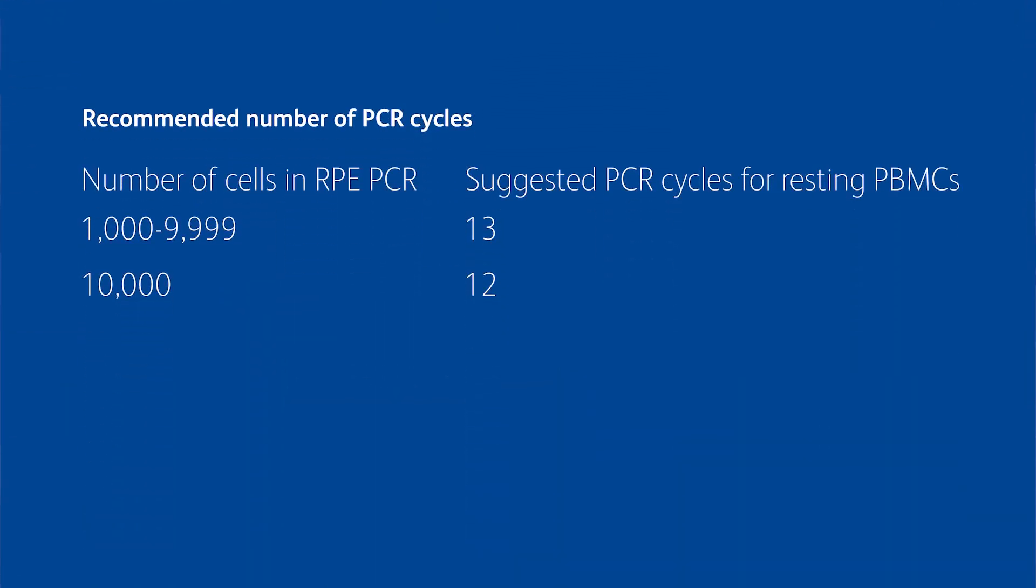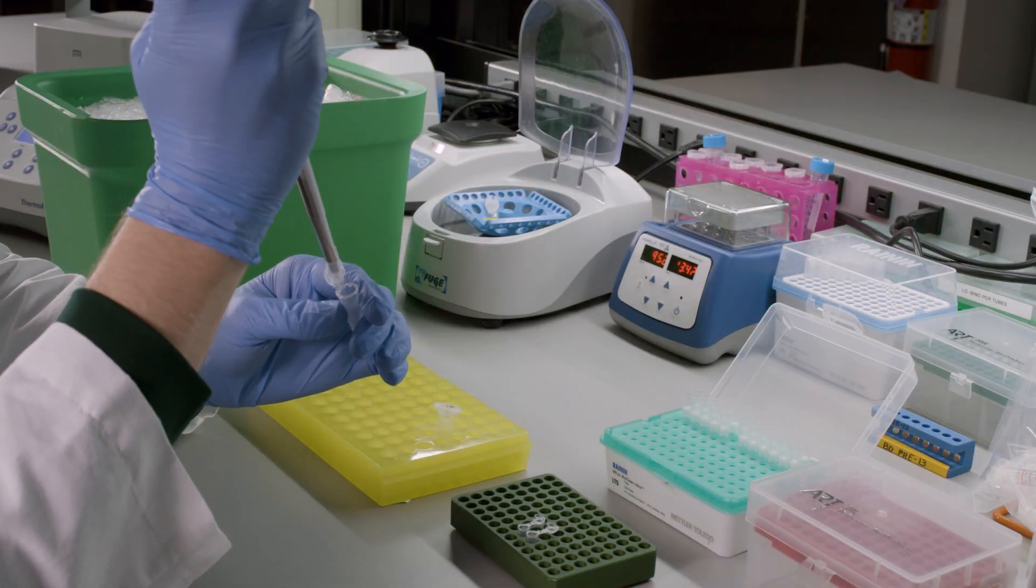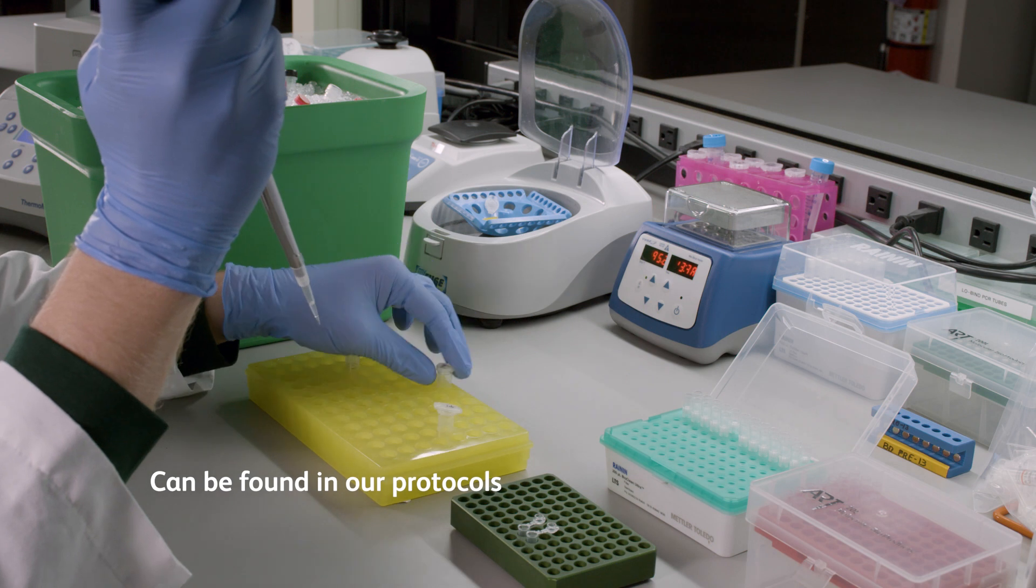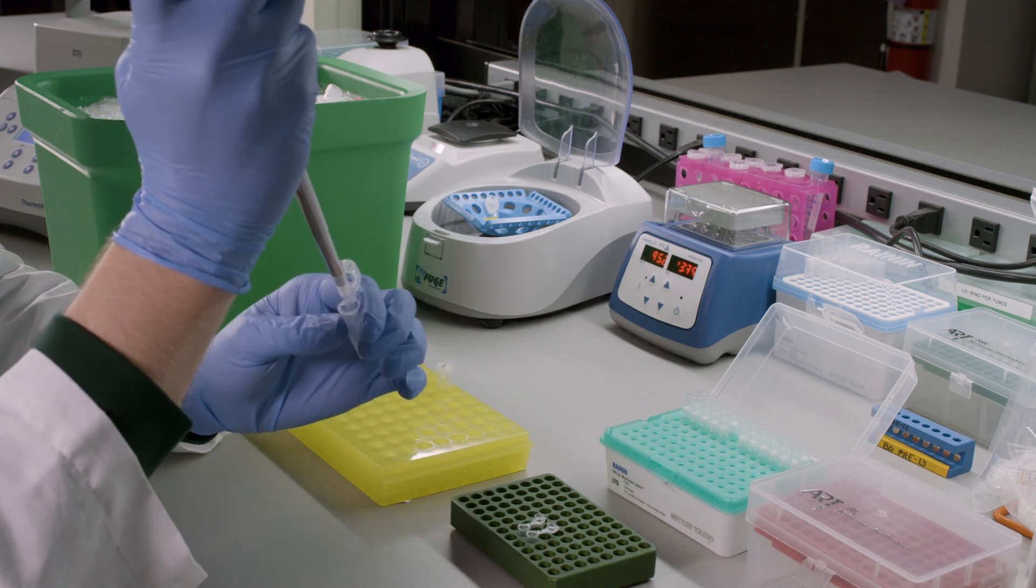The number of cycles is dependent on the number of cells being processed. Guidelines for cycle numbers can be found in our protocols. For our example of 5,000 cells, we will use 13 cycles.